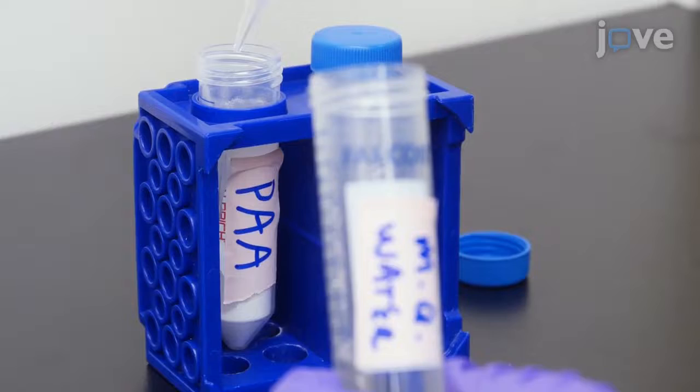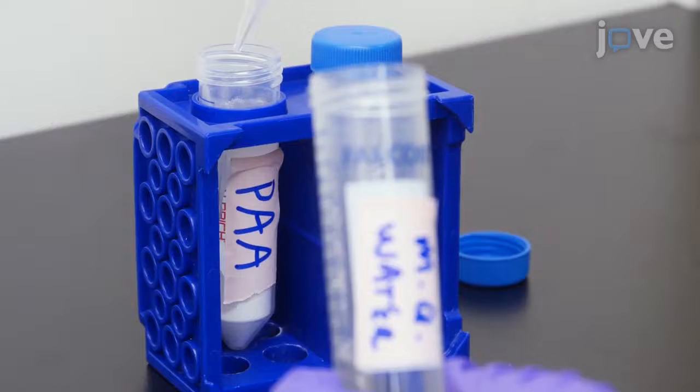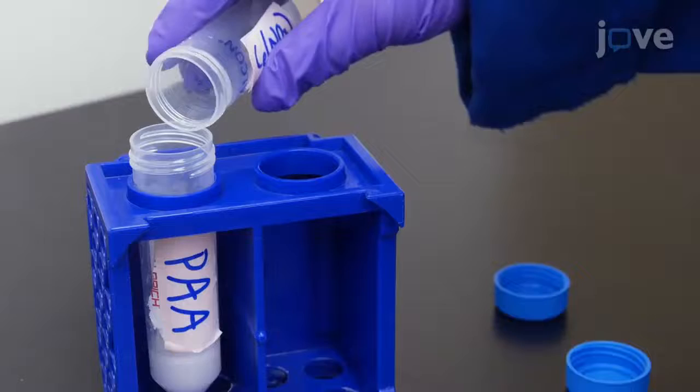Weigh out 4.5 grams of polyacrylic acid and dissolve it in 5 milliliters of biology-grade water in a different 50-milliliter conical tube.